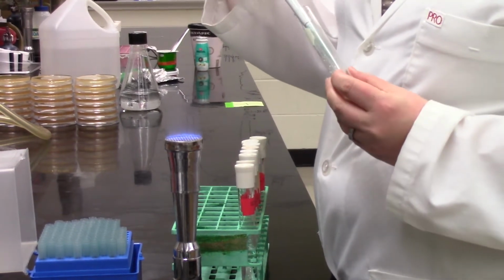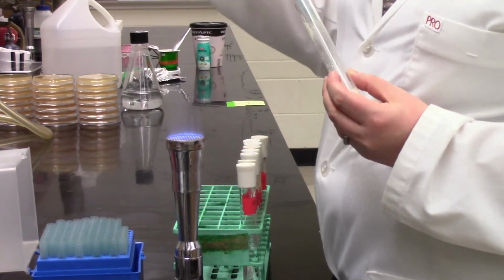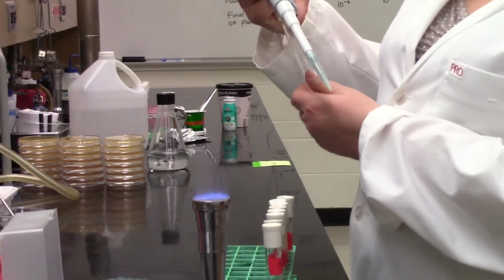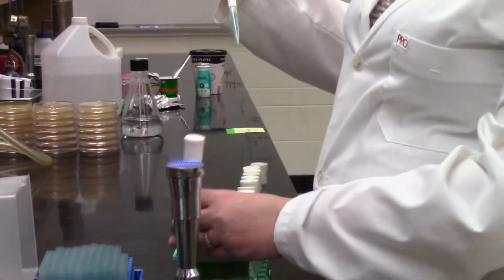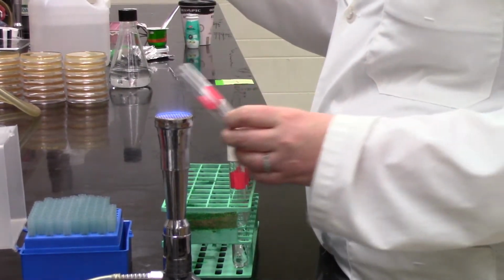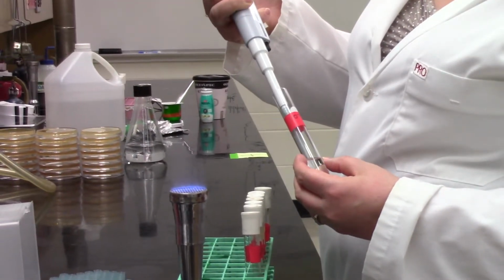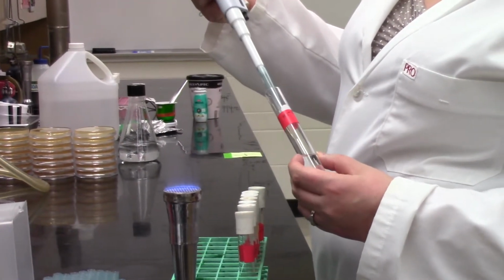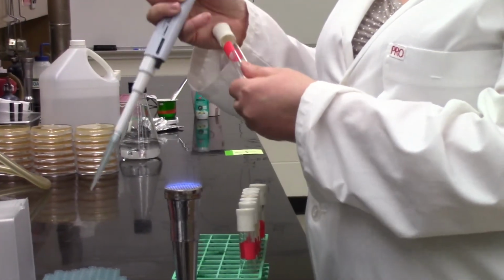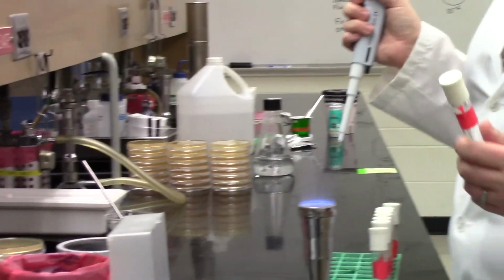Right now, Sabrina's getting a pipette tip on the micropipetter. She's got it set at this point to 100 microliters. So she's going to make an initial dilution of 100 microliters, you can see her flaming the tube there, into 9.9 mils of saline. As discussed in class, that is a 100-fold dilution, or a 10 to the minus 2 dilution. She's put in her 100 microliters, she's flaming her tube, discarding her tip into the biohazard there.